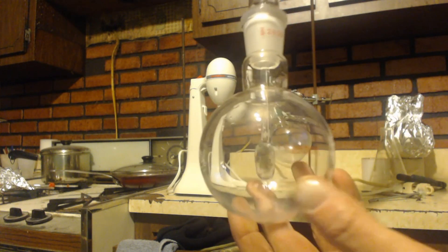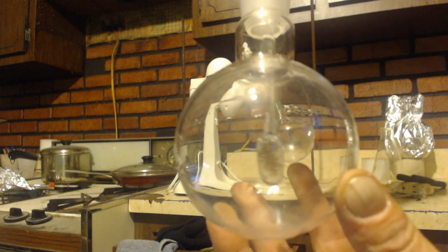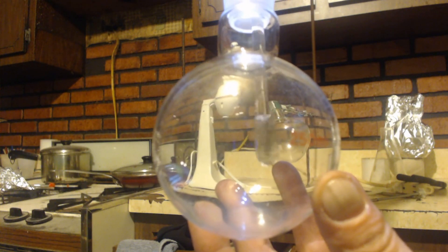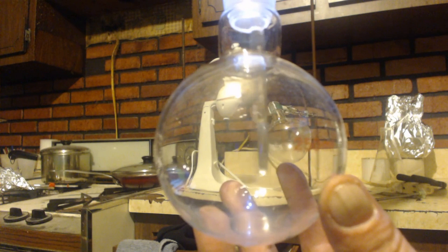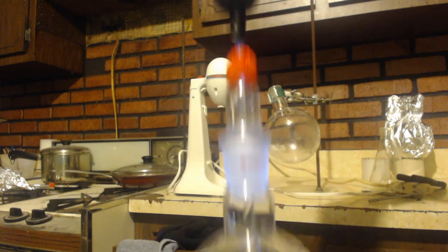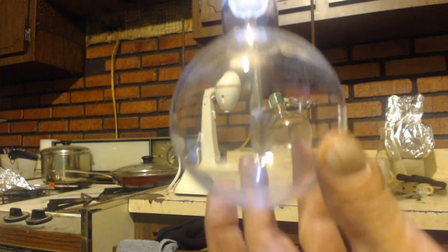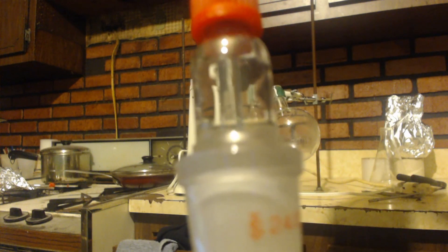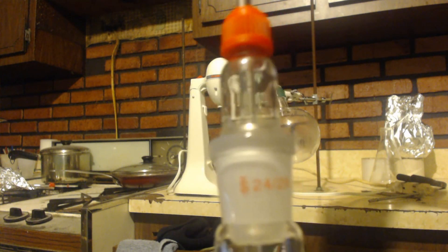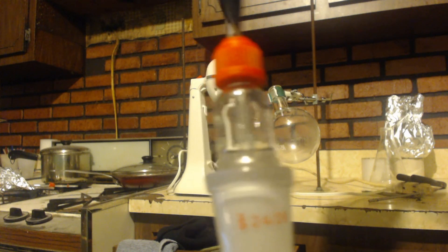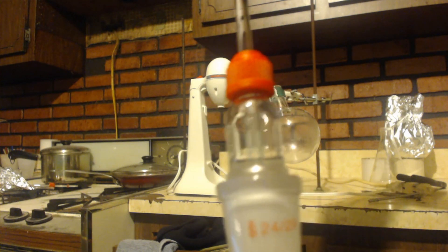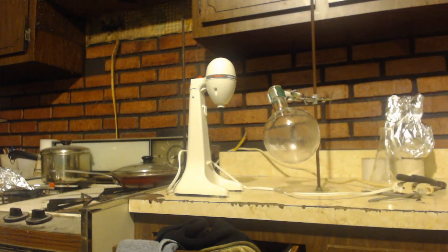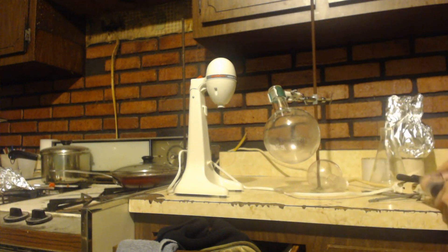I don't know if you can see inside there or not. This has a gasket in here. It just barely turns. I mean I have some resistance when I'm pulling it up and down, but there is a gasket in there.